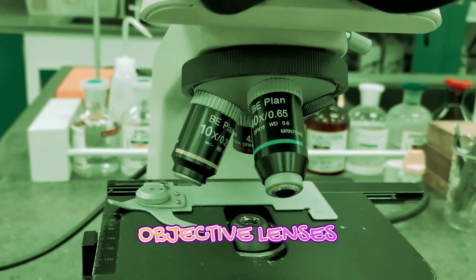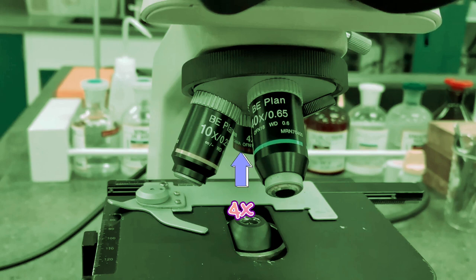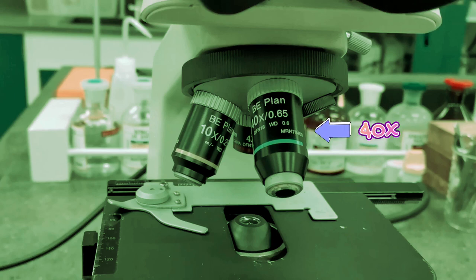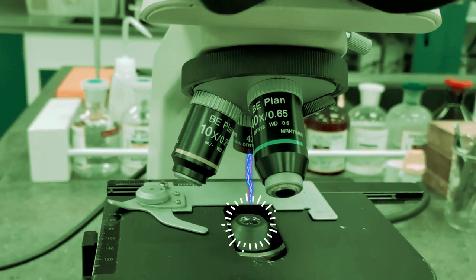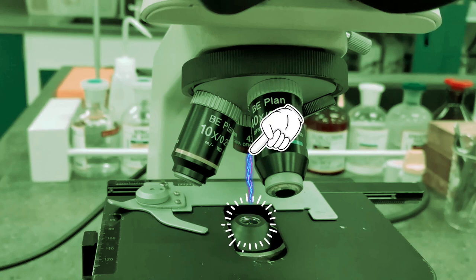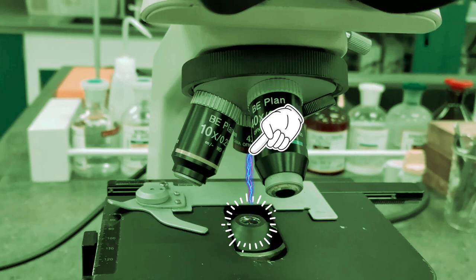These are your objective lenses and there are three types. The first is the 4x objective lens, the second is the 10x objective lens, and the third is the 40x objective lens. You need to make sure that you fix the objective lens right above where the light is coming from before you start looking into your specimen.